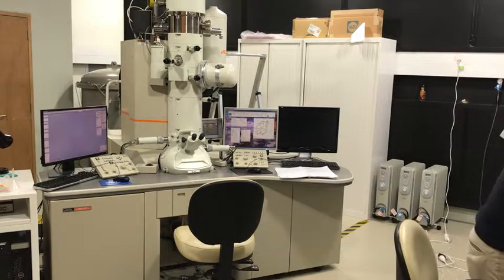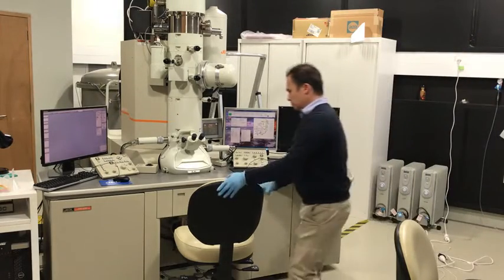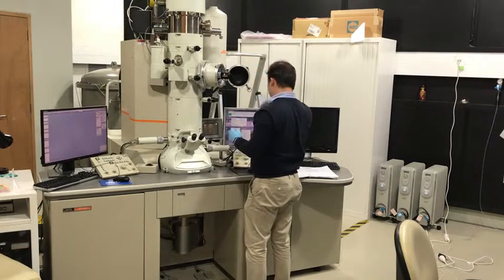Now, just going to prepare the bench. Remove the chair. Open the cover.